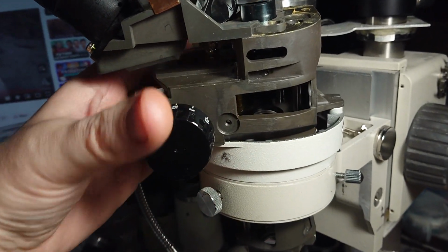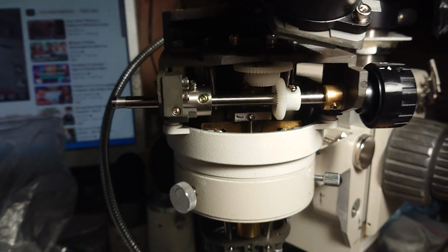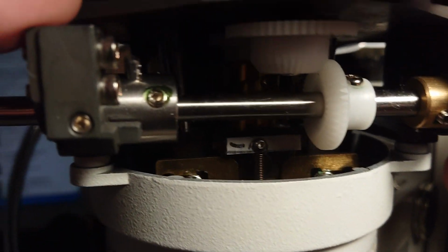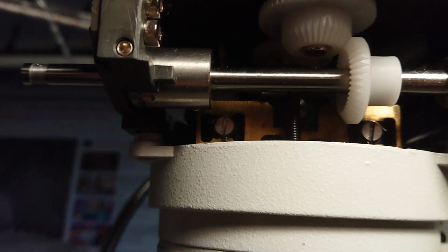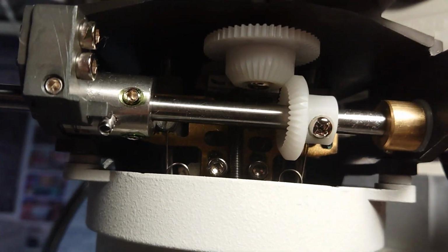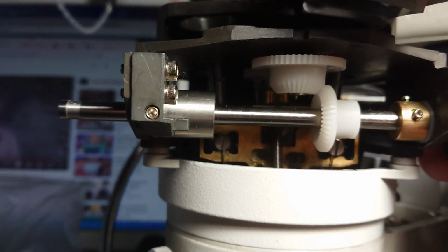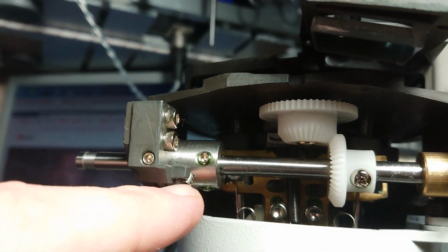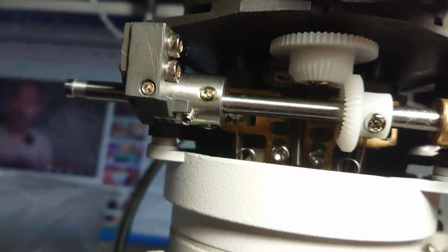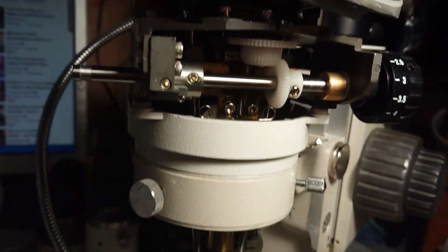It's the last thing I have to finish, and this microscope has a pretty increased resolution. And by the way, for those who want to increase the magnification a bit, you can take this part, it's a limiter. When this thing rotates, it limits the zooming system in both directions. So if you want to make the zoom range a bit higher, you just need to cut away a bit of this pin. If this pin is cut away, you can get a little more zoom range. It might be pretty useful for some applications.